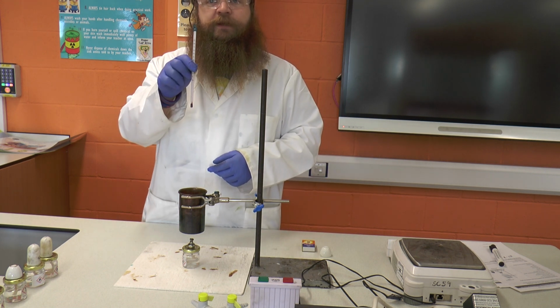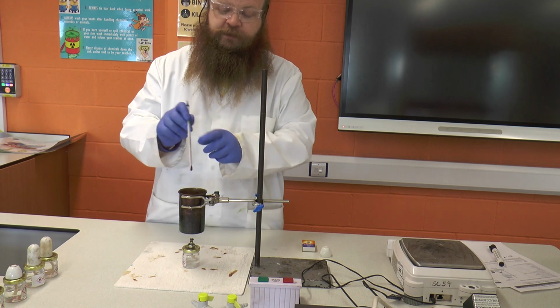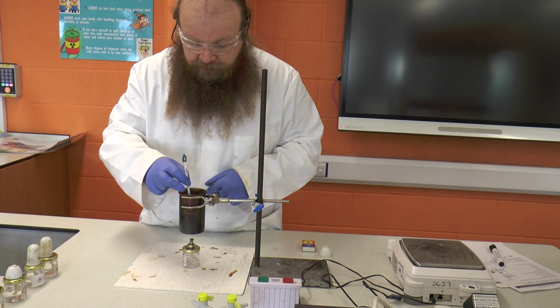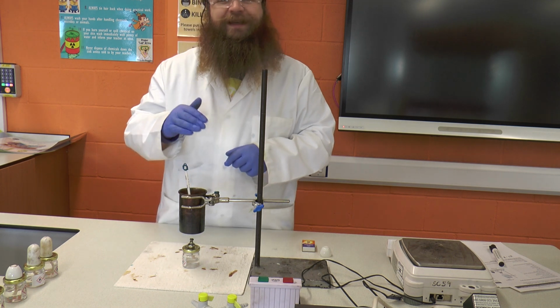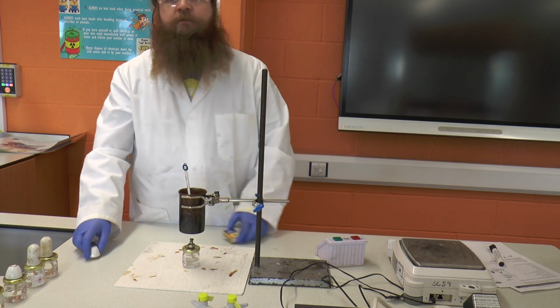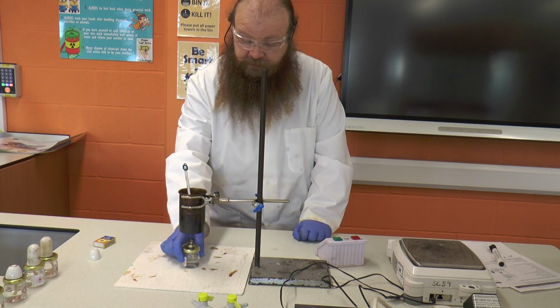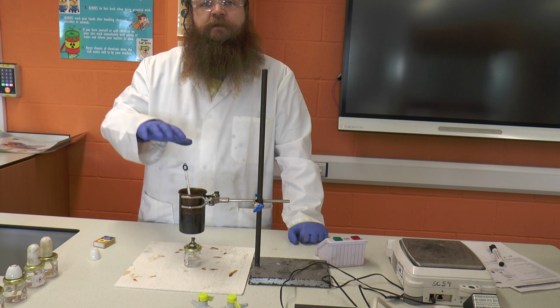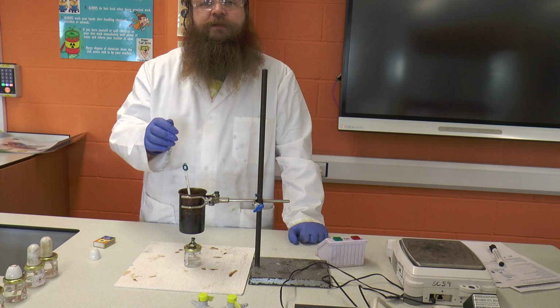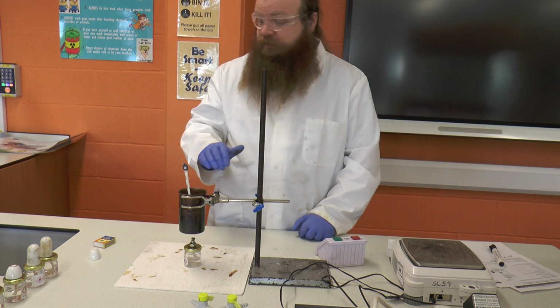Now we're going to measure the temperature change in that water. We're going to use an ordinary liquid in glass thermometer, and we're going to make sure that our 50 ml covers the bulb. That's the little bottom bit of our thermometer. This is the bit that is used to measure the temperature, and that needs to be completely below the level of the water. If it's not, you will not get an accurate reading for the temperature. So we will take our initial temperature reading before we start. We're going to leave the thermometer in there for a minute or so to acclimatise to the temperature of the water, because liquid in glass thermometers are not instantaneous, there's a slight lag.